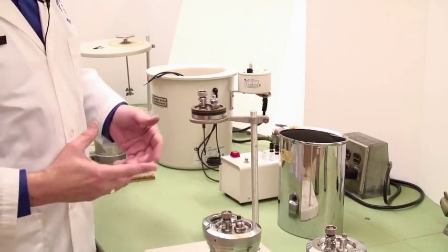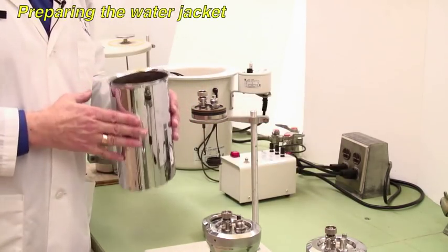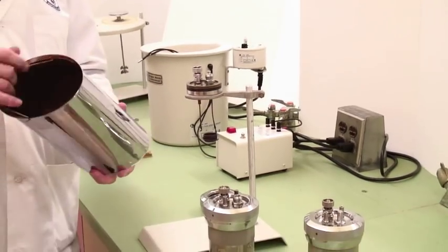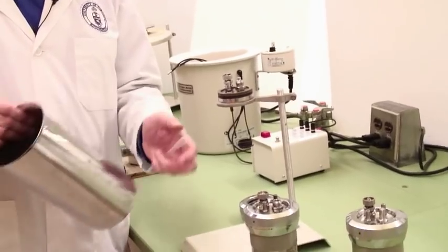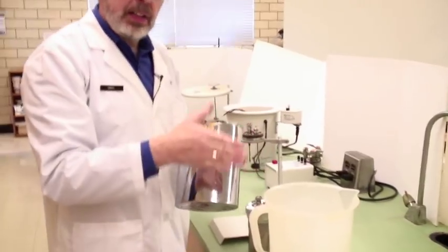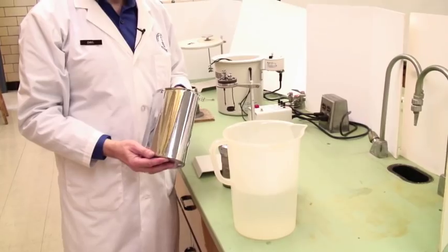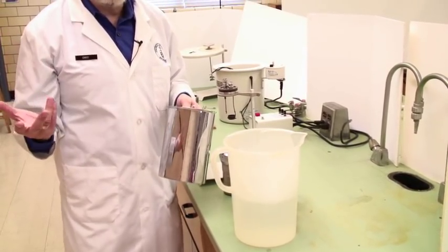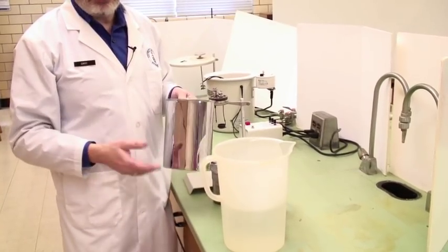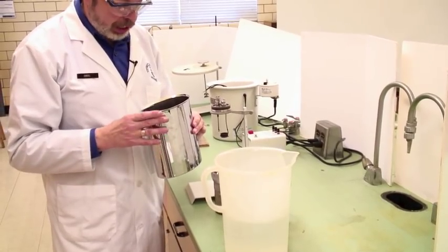The first thing we need to do is actually get the water in there because it needs to be measured precisely. You will need the calorimeter bucket, a dropper, and a jug of distilled water. We use distilled not because it needs to be particularly pure but because the distilled water is sitting in a tank somewhere and so it's at room temperature. If you use tap water it'll be cold and that coming back up to room temperature gives you awkward temperature changes.